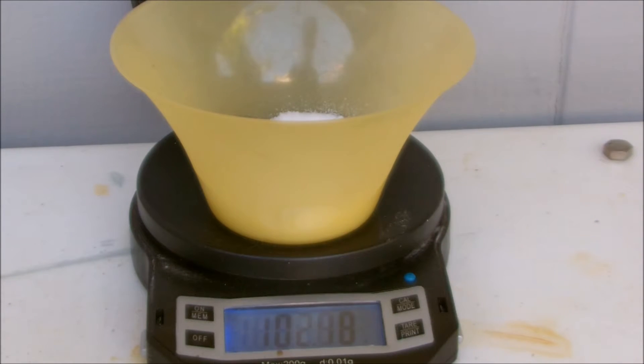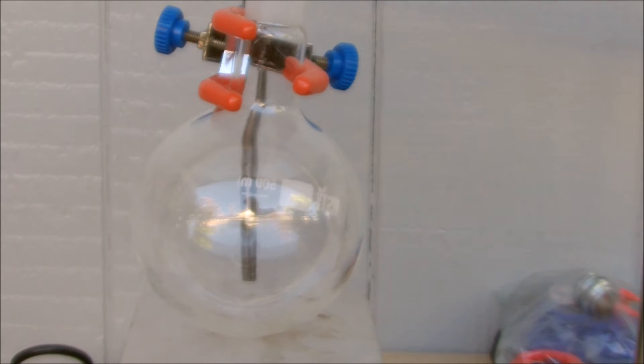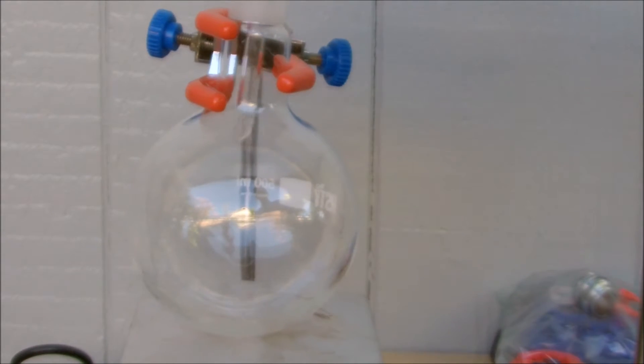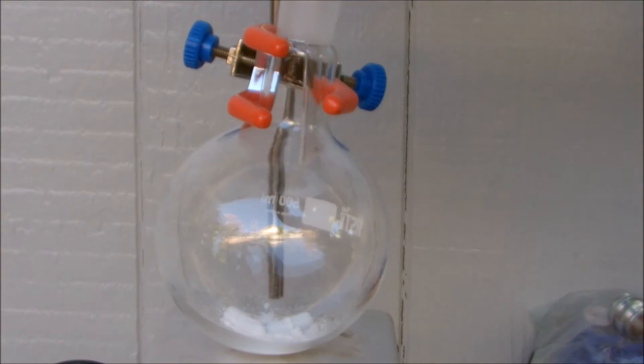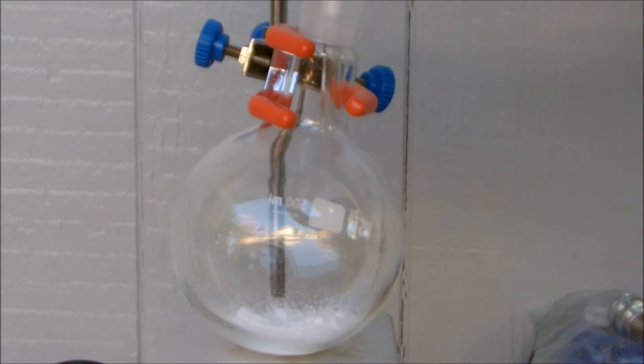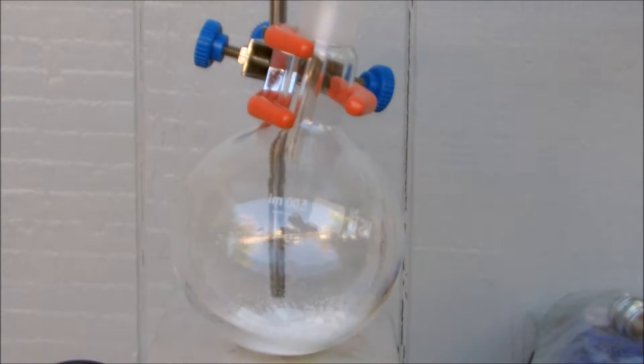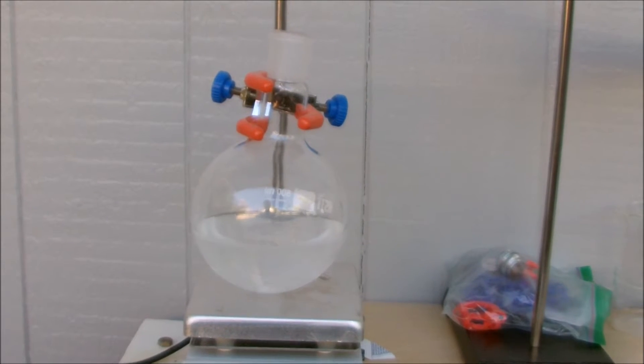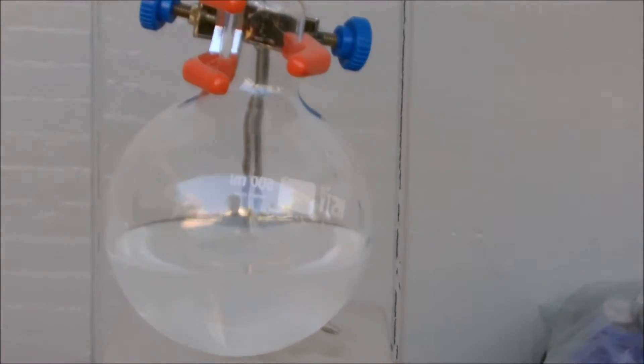Now we dissolve it in as little water as possible. I'm going to do this in my 500 milliliter reaction flask. The solution is almost clear and dissolved.